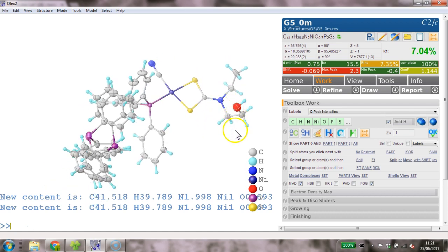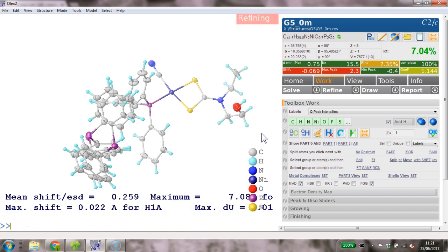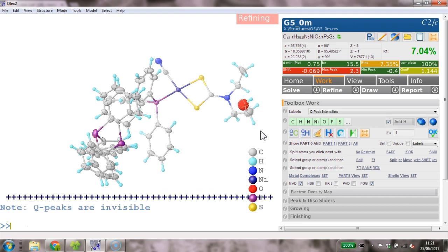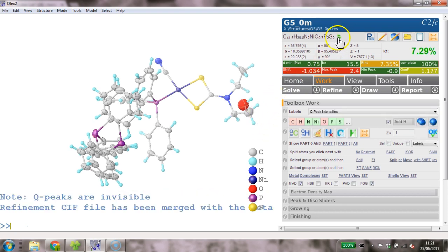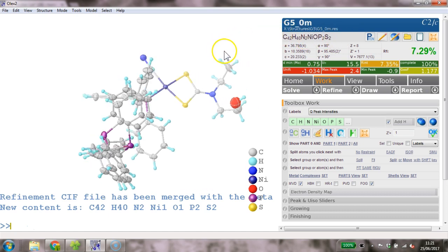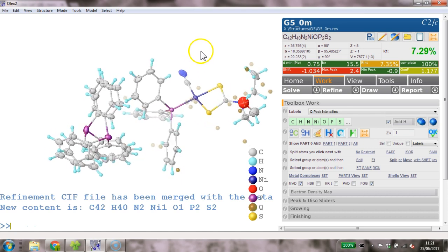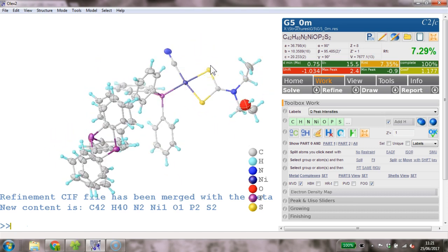Yep, these occupancies haven't been set correctly earlier, so we need to go fix OCC. So make sure that these are all 1. This is from the previous disorder model that was hanging over. And now just the formula. So this is all nice and integral. The Q peaks that are remaining here, they are still here, but I don't think there's anything much we can do with them. And we adjusted Z and Z prime.